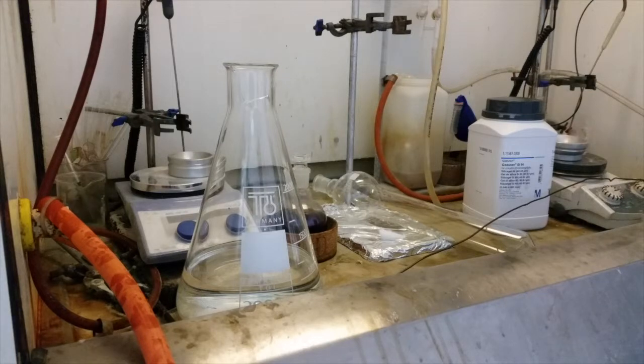Hello and welcome back to Porphyrin Bootcamp. Today we'll be showing you how to utilize column chromatography to purify any crude porphyrins you have.